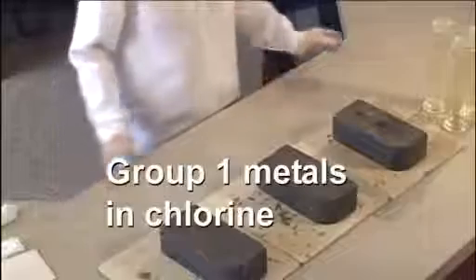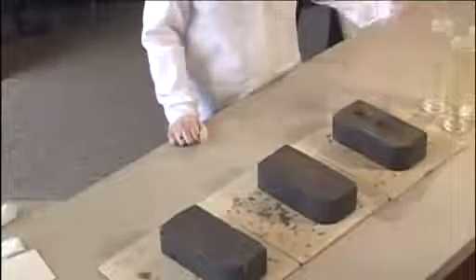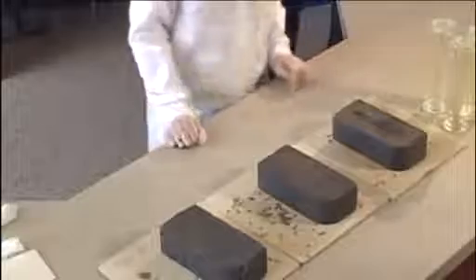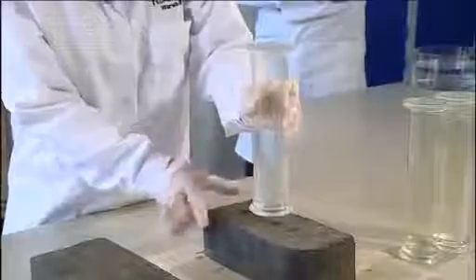For this you will need some previously prepared chlorine stored in a gas jar sealed with Vaseline. You should make sure that there is a green colour of the gas in the gas jar. You should also make sure that the opening of the gas jar is smaller than the brick, so you don't lose the chlorine out when you put it over the burning piece of metal.